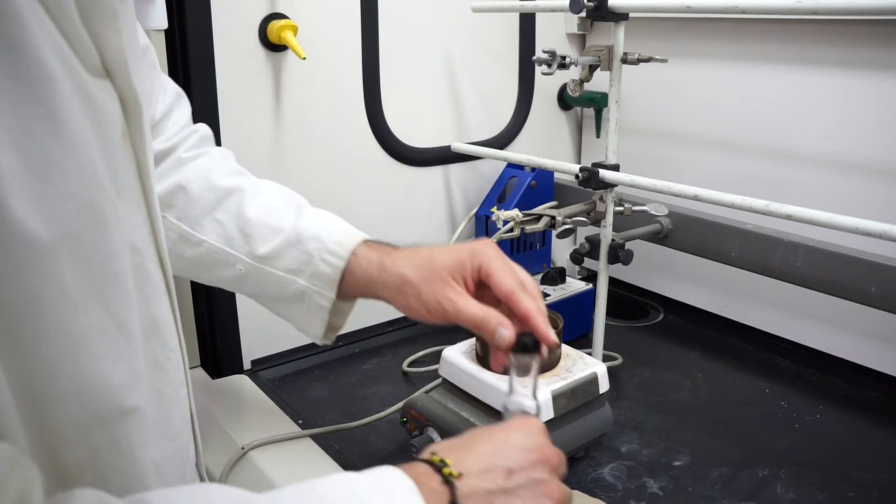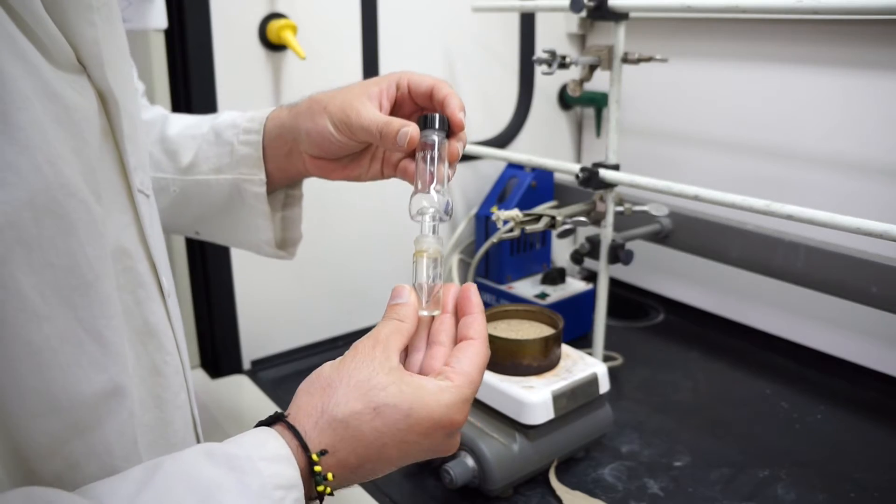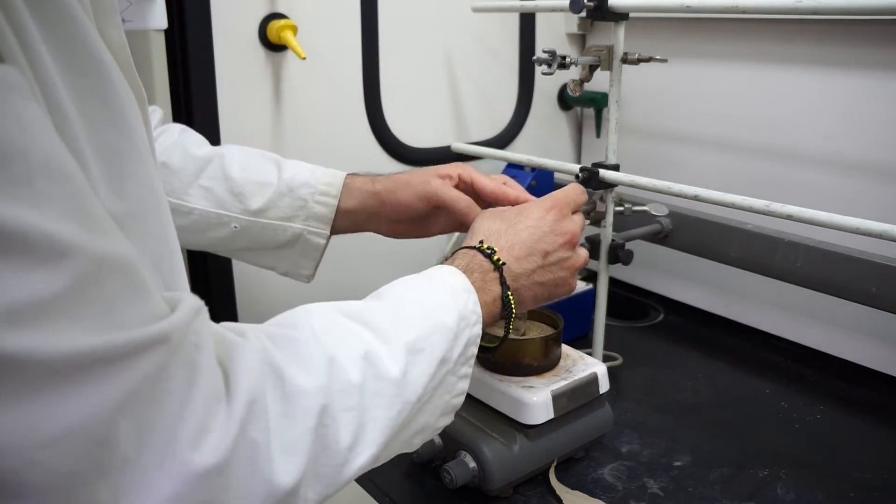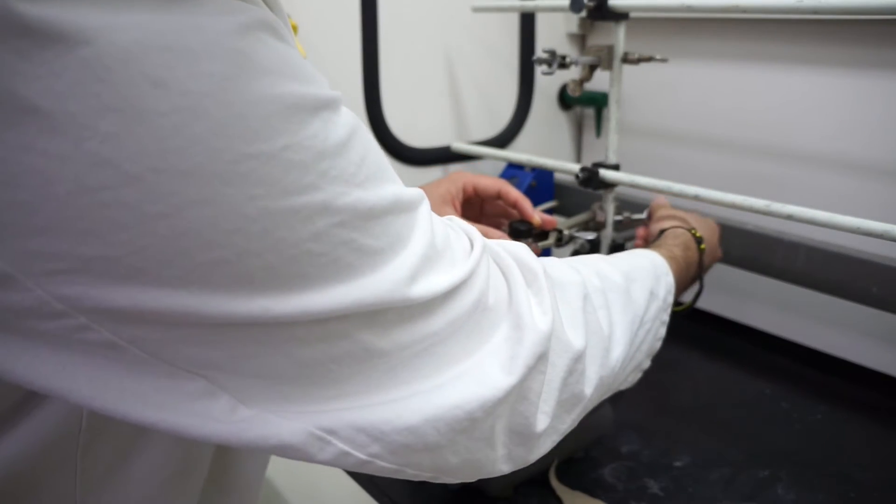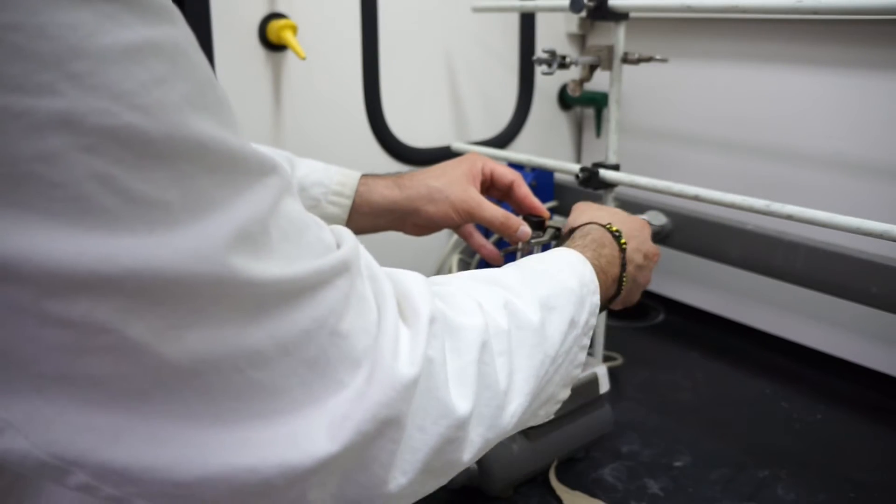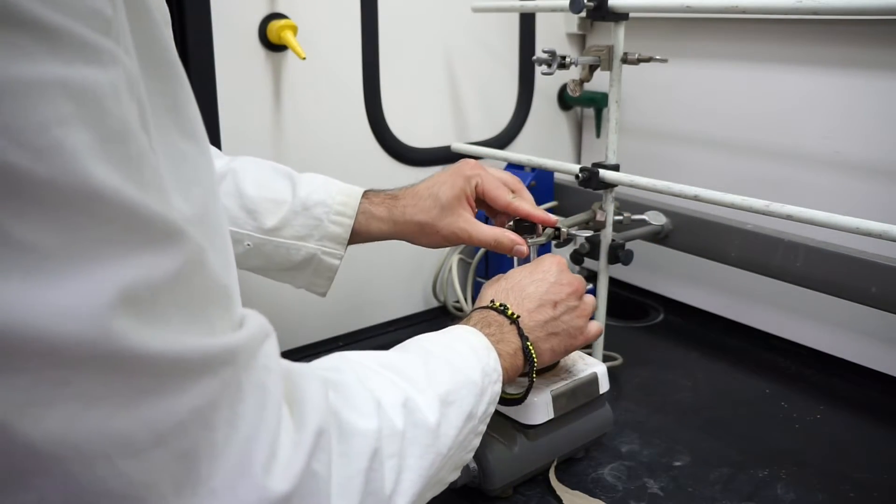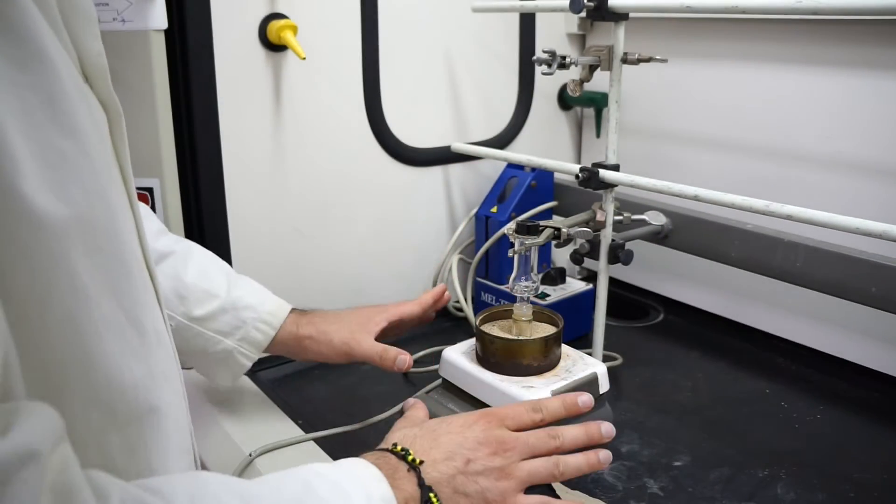Now let's set up our reaction. We have our two glass pieces connected together. I'm going to place them firmly into our sand bath and immediately clamp them. I'm going to lower this down and clamp the glass pieces, making sure it's nice and stable right over the sand bath.